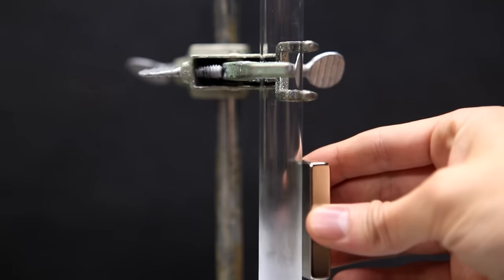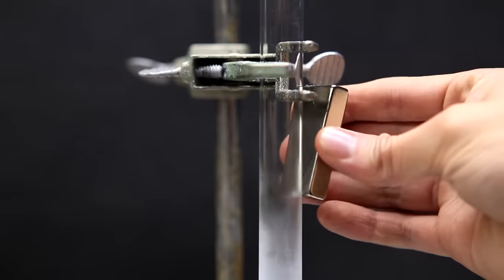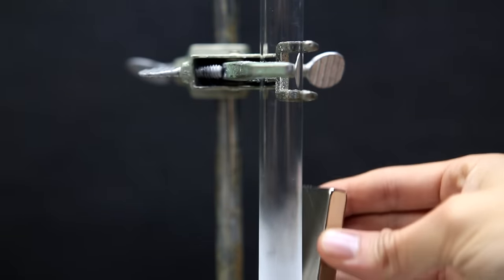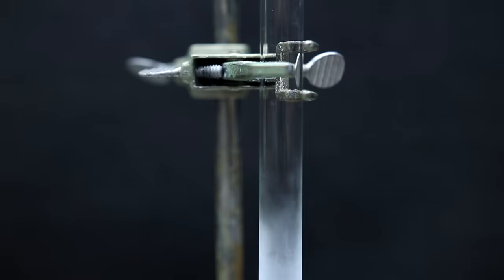When we place a magnet next to the liquid oxygen and pull up, we can actually see a small glob of liquid oxygen going with it. And when we pull the magnet away, the drop falls back down.